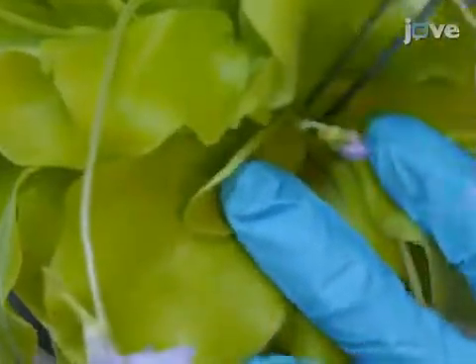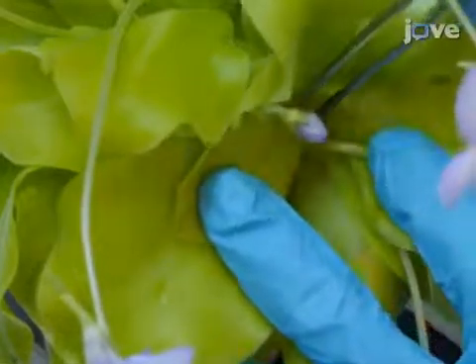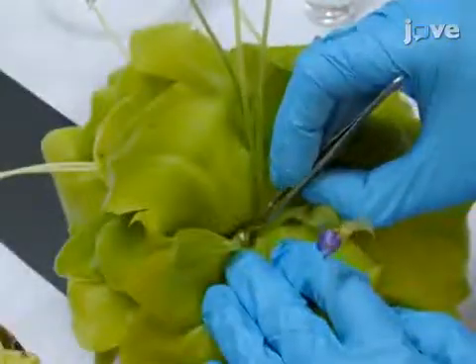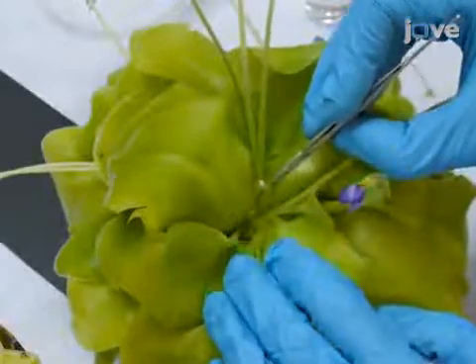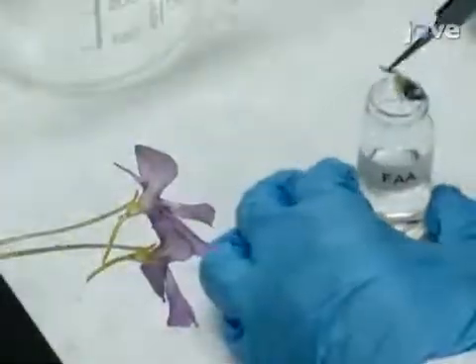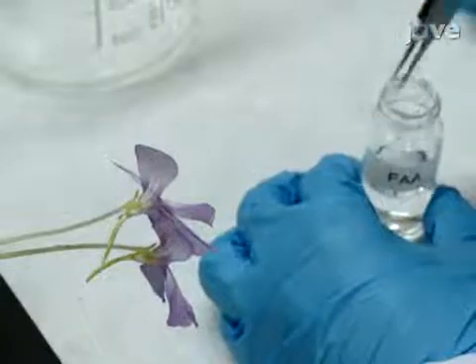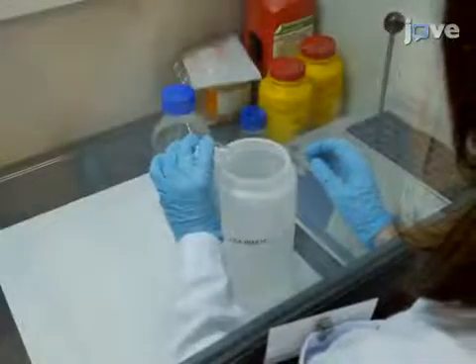Select the floral or vegetative meristems to fix, ensuring that they are not damaged by insects, fungi, or extreme weather conditions. Cut the branches, removing unwanted material, and deposit the sample immediately in the FAA solution.